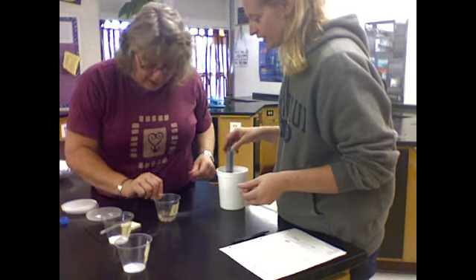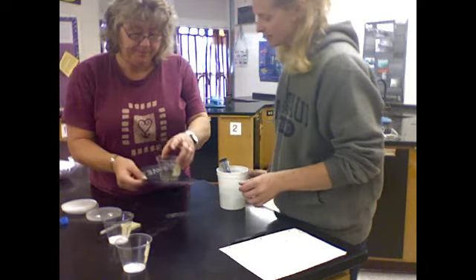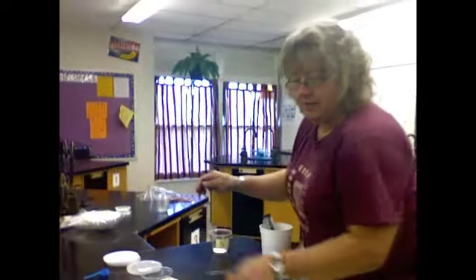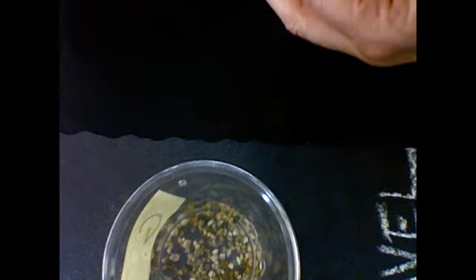I wonder if we should bring this up close and personal for people to see. So I'm going to stir, and besides getting wet and looking a little darker and prettier, I don't see anything else happening to the gravel. Do you notice anything? No, I don't see anything else changing in it whatsoever. All right. So apparently in that case, the water didn't make much of a difference.